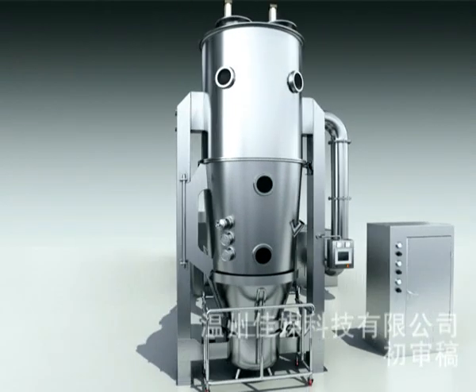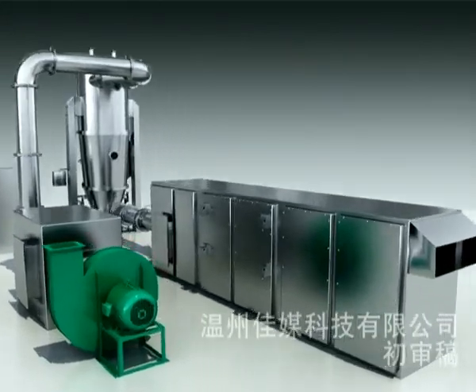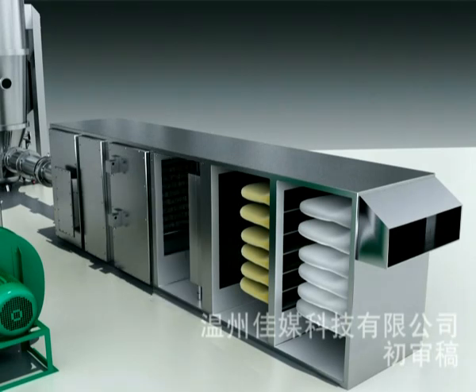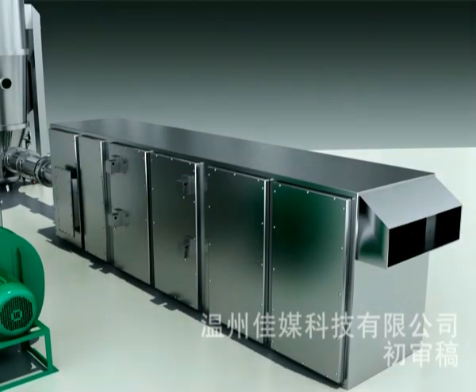Air inlet system. The air inlet opening is normally in the auxiliary machine room or outdoors. The air inlet system, also known as the air inlet handler, normally consists of pre-filter, post-filter, steam heat exchanger, sub-high efficiency filter, and/or HEPA filter. Dehumidify with preheating arrangements and air inlet bypass of heat exchanger are available on request.